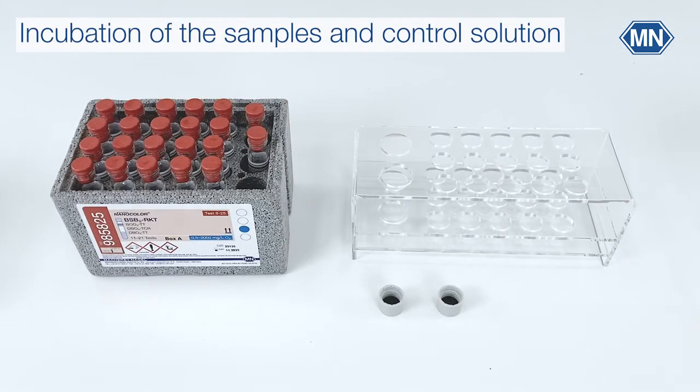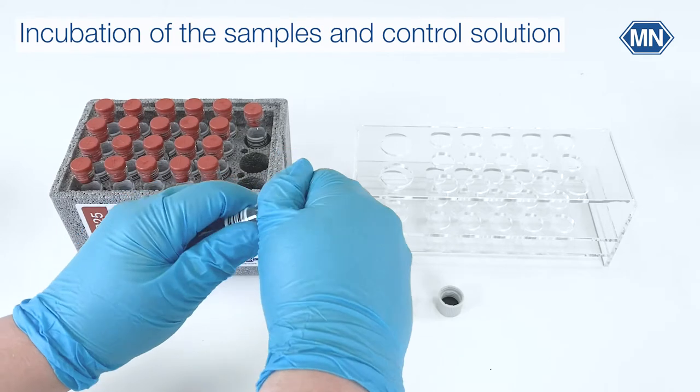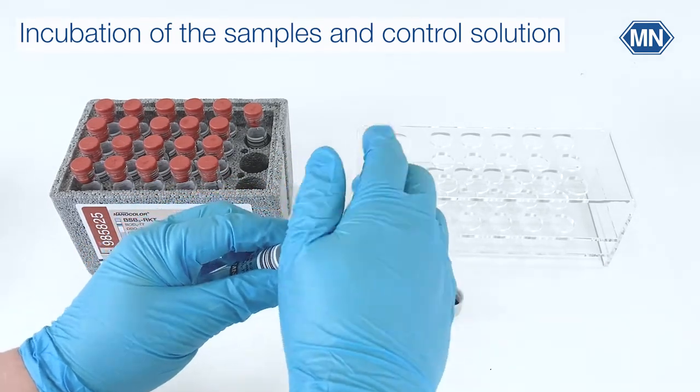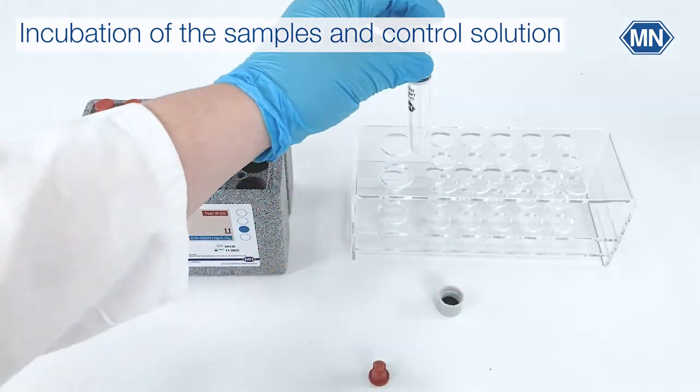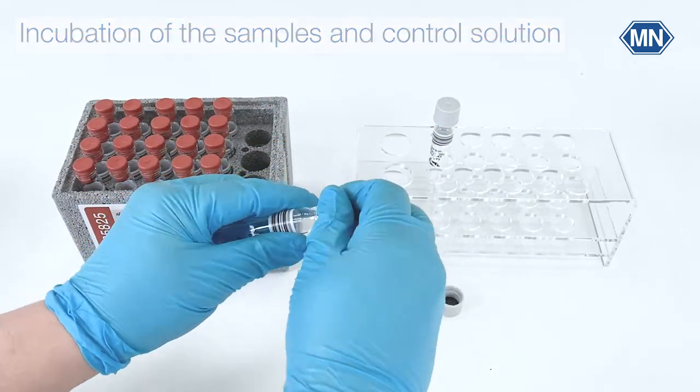After preparing the diluting water you can now start incubating your samples. Prior to testing take the needed amount of test tubes out of the box and replace the rubber stopper with the screw caps provided. Remember to take one additional test tube for making the control solution.